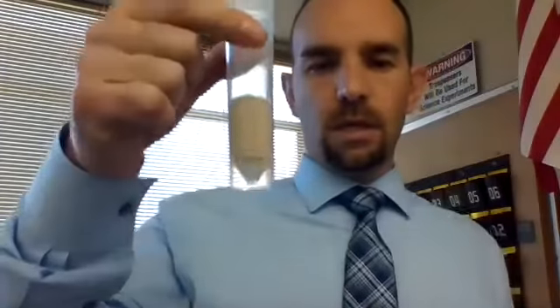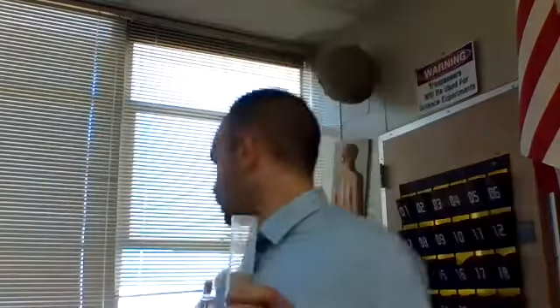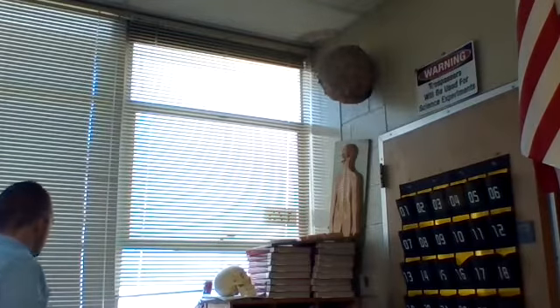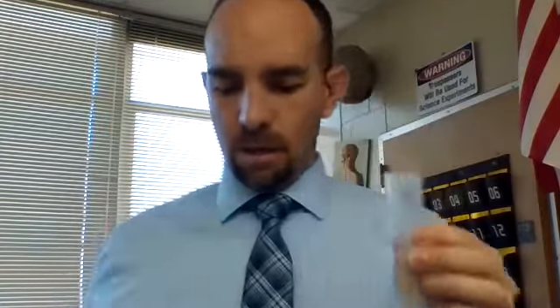So what we would have done in lab was taken a centrifuge tube like this. We would have taken tubes and gotten it to fit in like so — it would be up in the air, hanging.